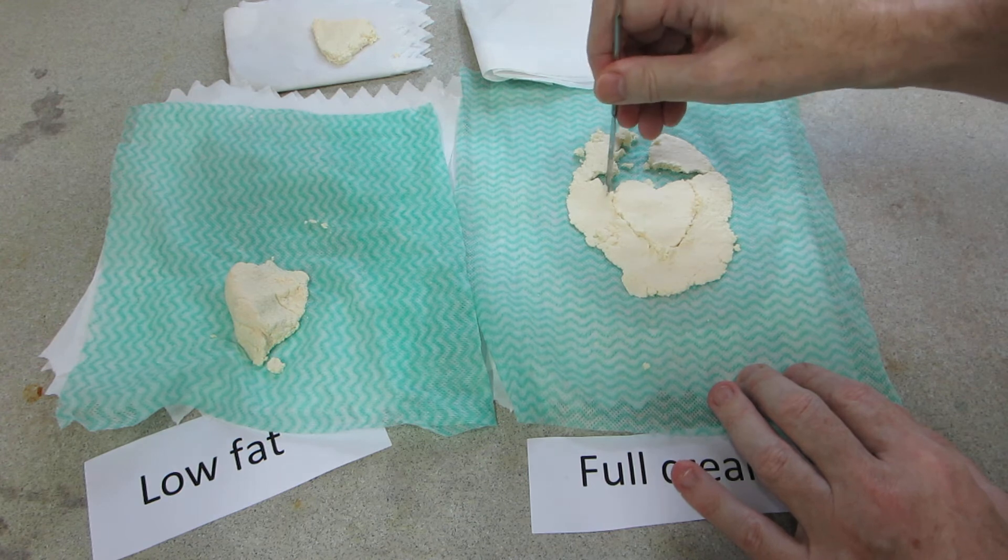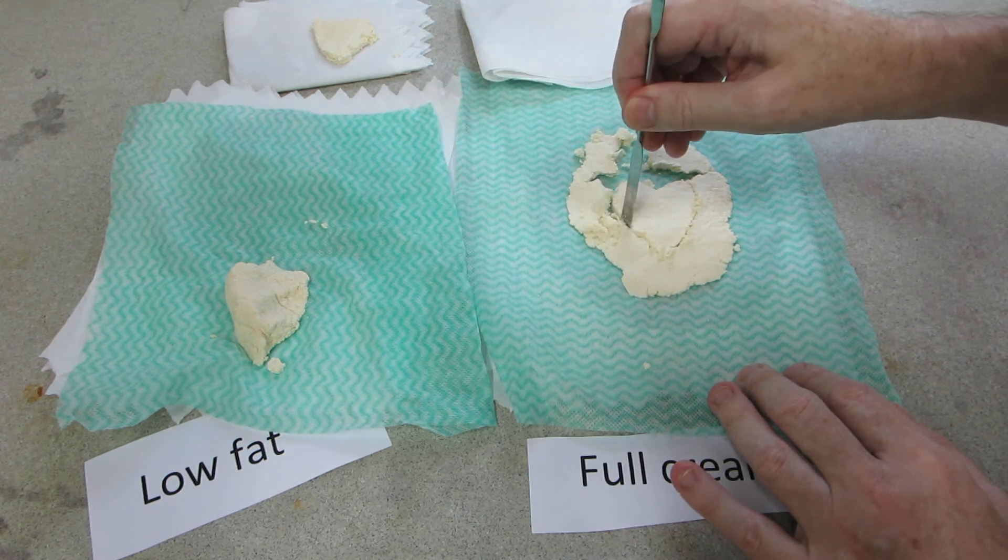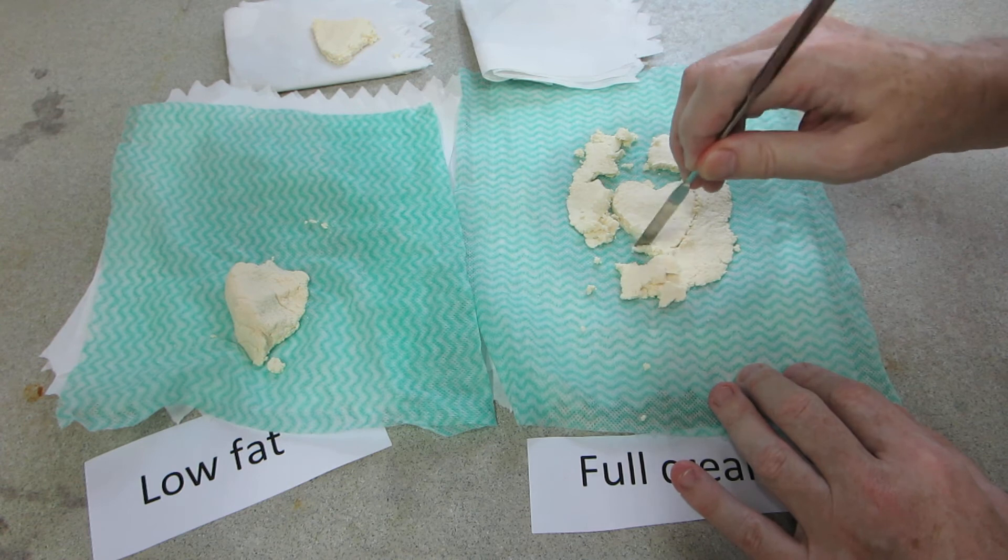I've got rather more spread out on this side, but then again, that might be apt: high fat.